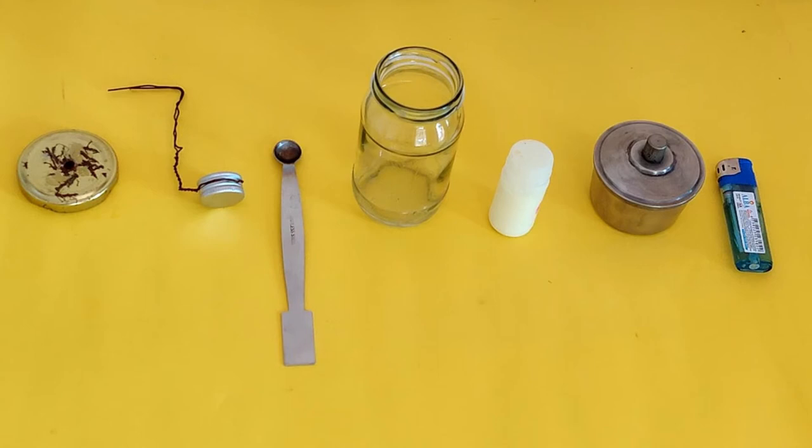Next, we will test the nature of the product of the reaction between sulfur dioxide and water. For this, add a few drops of water to the glass jar and set it aside.